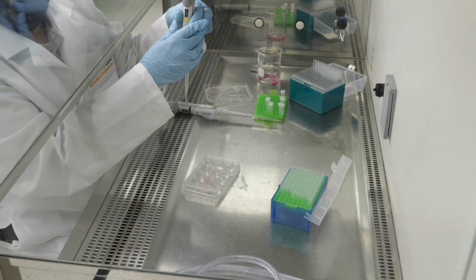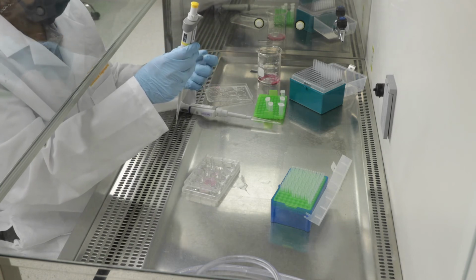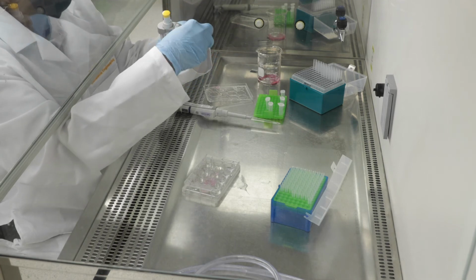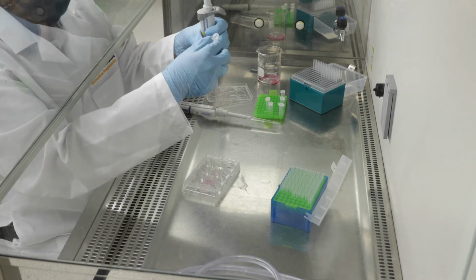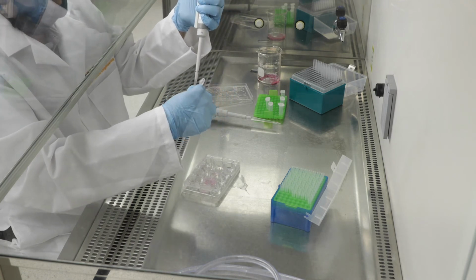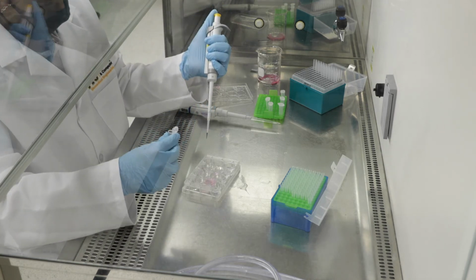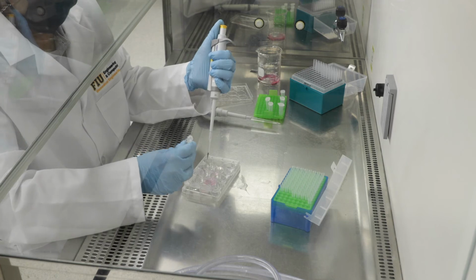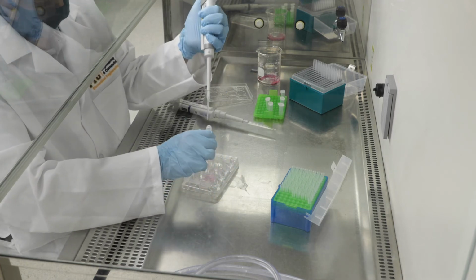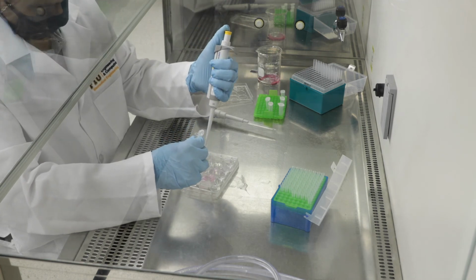We add 20 microliters of trypan blue to each gel section. Again, refer to your session 4 protocol for exact numbers, but 20 microliters is typically a standard for a 150 micron thick, small-sized gel section like the ones that we cut up. And here you can see me pipetting the 20 microliters into the well plate, which contains each of our gel sections, and we cut up 4 such sections.